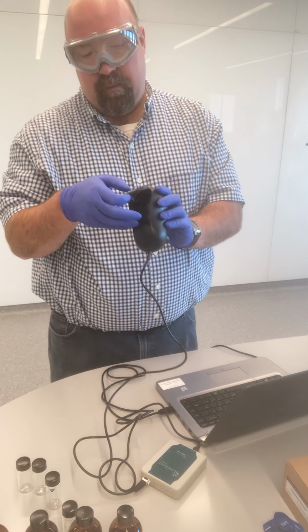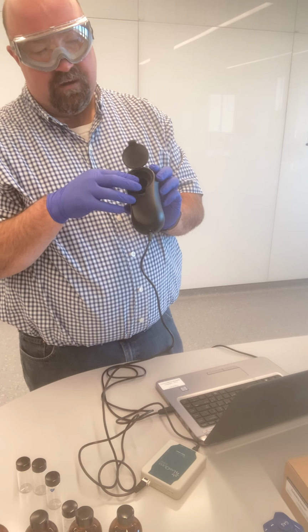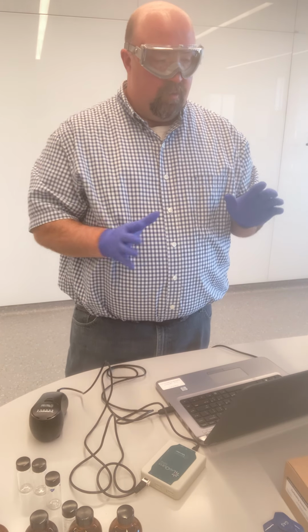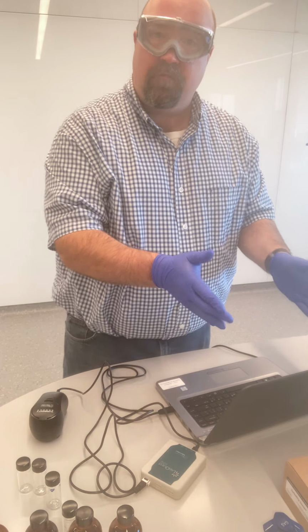Now, just to give you an idea of the setup here, so again, we have the turbidity sensor, which we'll be putting the samples in, and we'll talk about that in just a minute. We're going to put our samples into the turbidity sensor, and after we have it calibrated, it's then going to give us our turbidity right on our screen in our software. Now, I just want to show that to you so you get an idea of what I'm looking at as I read the data here.